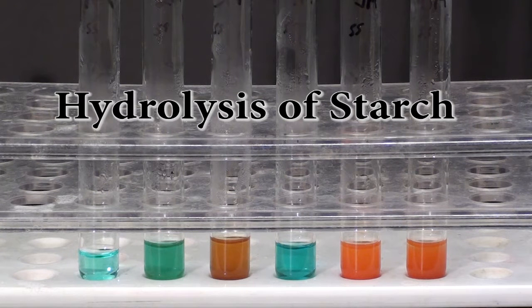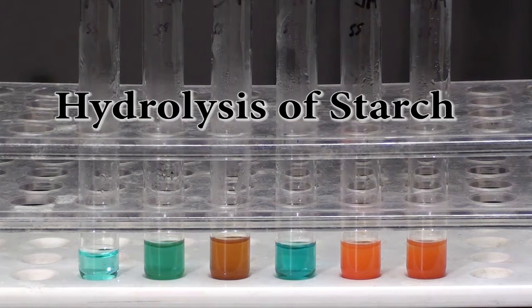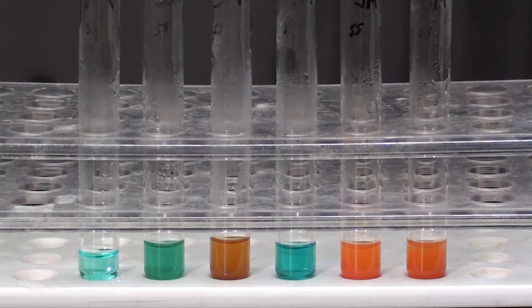Benedict's has been placed in these six tubes to look for sugar, presence of sugar.